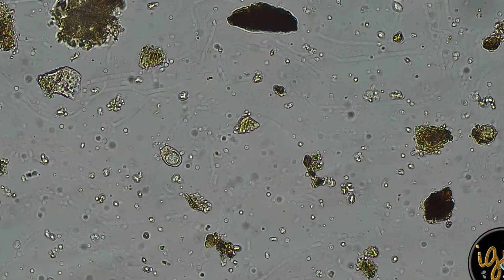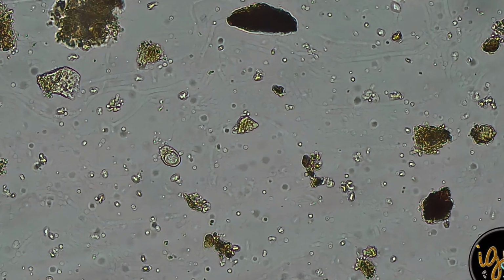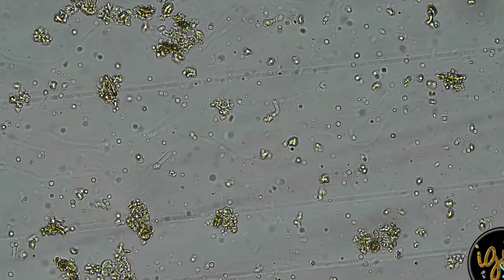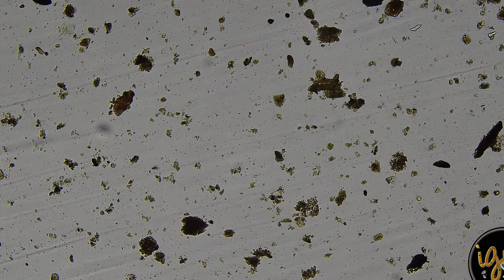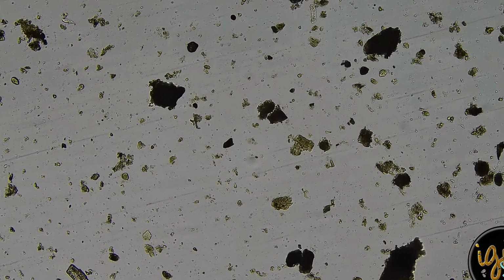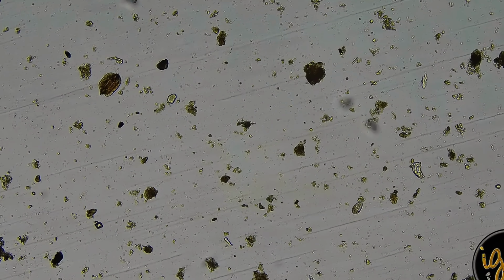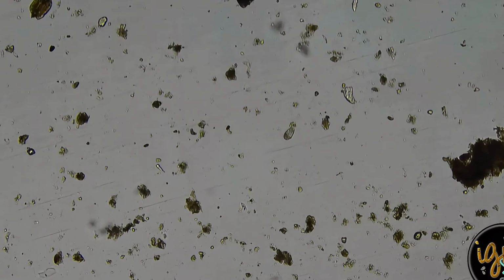So the idea when you do a soil sample is, for example, this is one field of view under 400. So if I were to do this, that would be another field of view, but I would have to be at 100. So basically this. There's a field of view, and then we look to see how many per field of view there are. We could slide over, and then we can see what's in this field of view. And this is when people are quantifying and counting things. I don't believe in counting things because it's impossible to count bacteria, if you ask me. There's no way I could tell you how much bacteria you have in your soil.